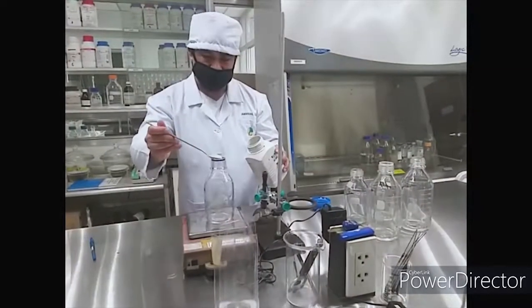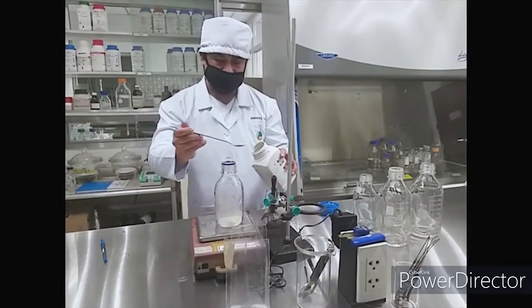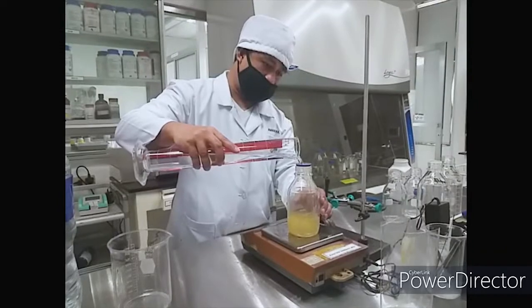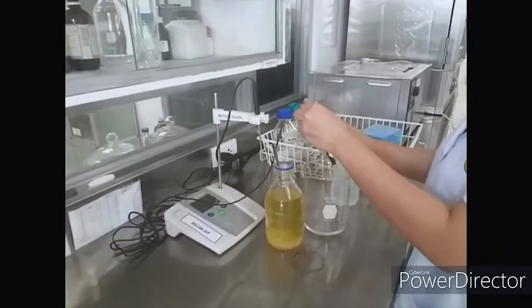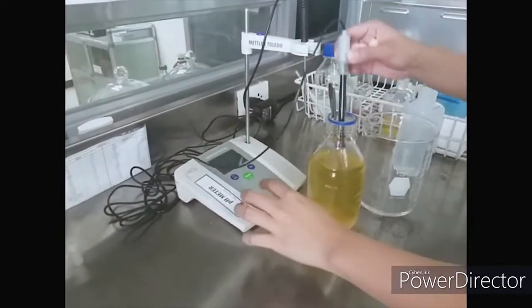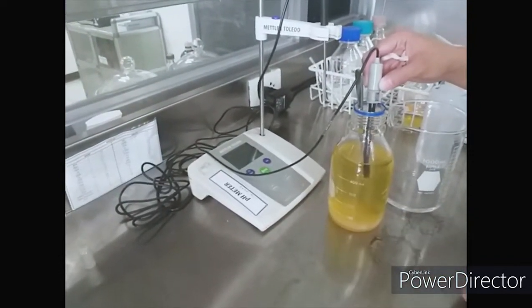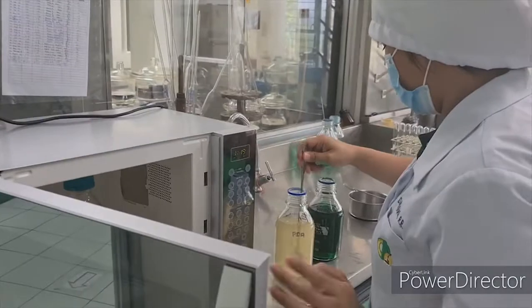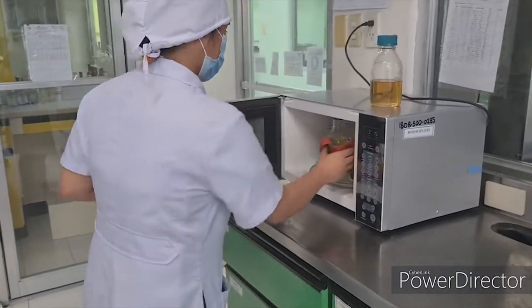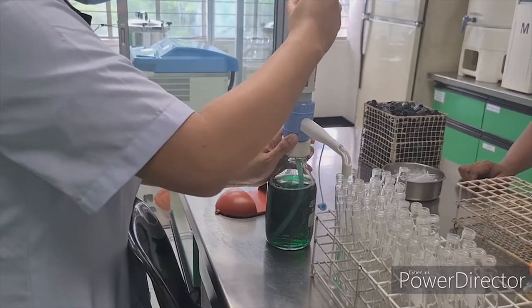Before analysis, media are prepared and materials are sterilized. In media preparation, the media powder is weighed, then reagent water is added. pH is monitored and adjusted using either sodium hydroxide or hydrochloric acid solution to achieve the desired pH. Media are heated before dispensing and sterilized in the autoclave at 121 degrees Celsius for 15 minutes.